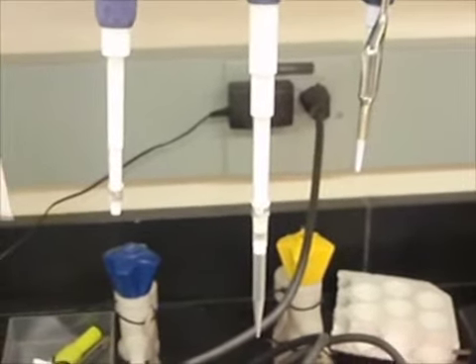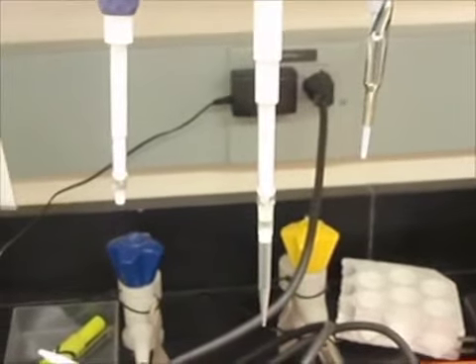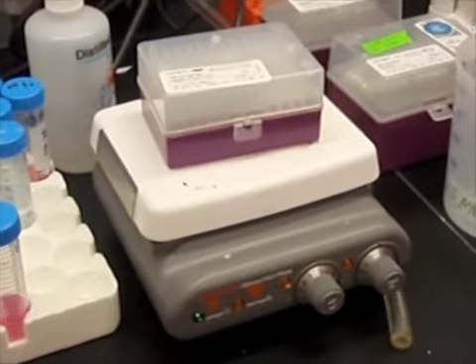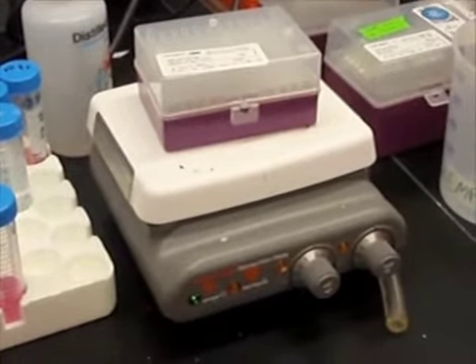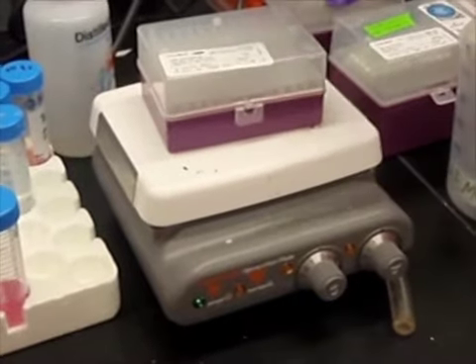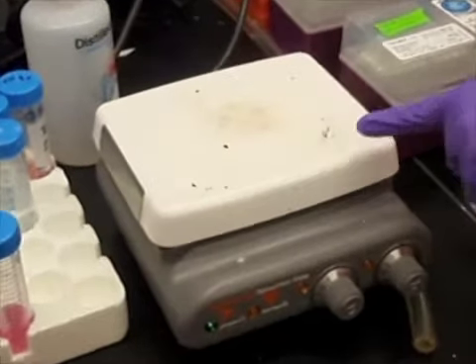This pipette is hung up with a tip still loaded, contaminated with who knows what. And speaking of pipettes, we already know from experience that plastic and heat don't mix. So what is this pipette box doing on a hot plate? And for that matter, what's going on underneath it?